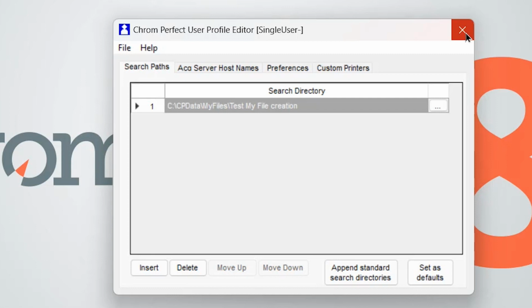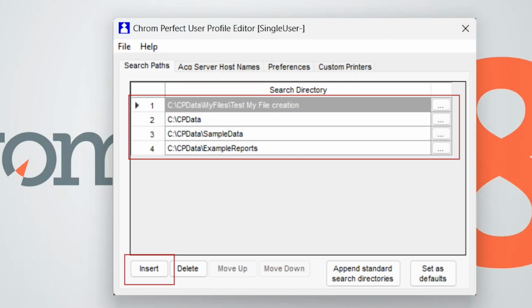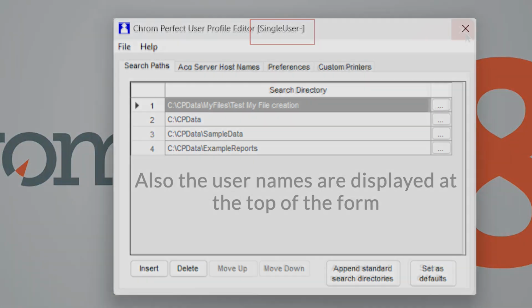Please note that by clicking the Insert button, multiple directories can be added and the system will check in all that are listed to find the files. Also note that search directories are user-specific. If you have Chromperfect security enabled and have multiple users, each user will have their own search directories which will need to be set up individually. You will know if security is enabled if you are asked for a username and password when you open the software. If this does not appear, Chromperfect is operating in single user mode.